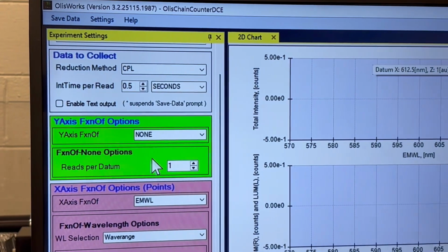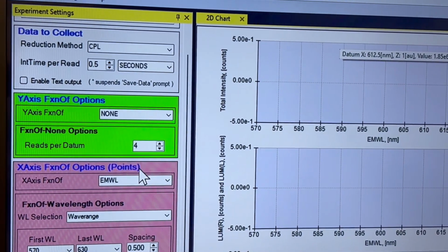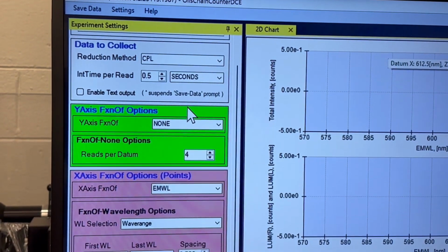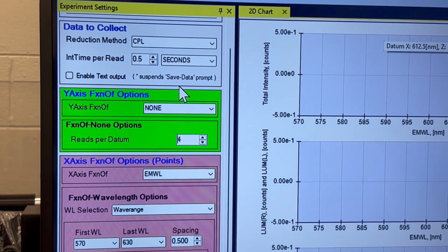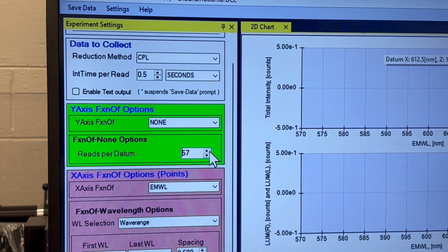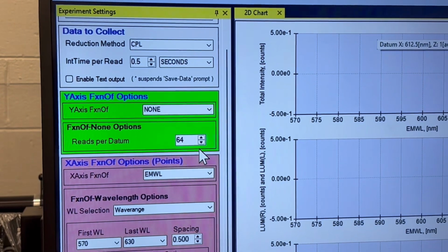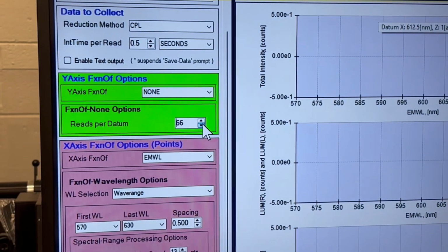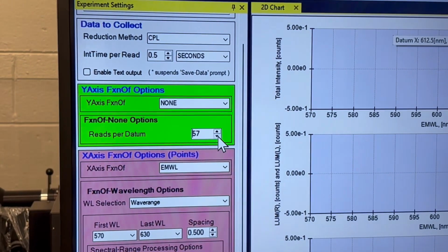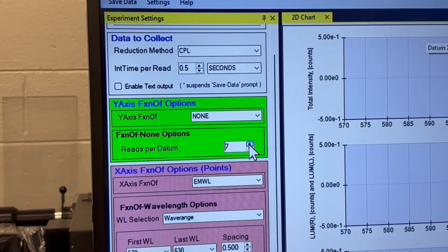And down here, I'm able to change the reads per datum. If I go here, for example, and set it to be 4, then it will do this half a second 4 times, i.e. about 2 seconds. And I get an improvement in signal to noise. Last night, for example, I had this set at 64, in which it really is slow, however, it's a whole lot of data. That's what you would use for a very small signal. Obviously it slows down the repetition. However, the signal to noise is greatly improved. Square root of 64 is 8, so you get a big improvement.